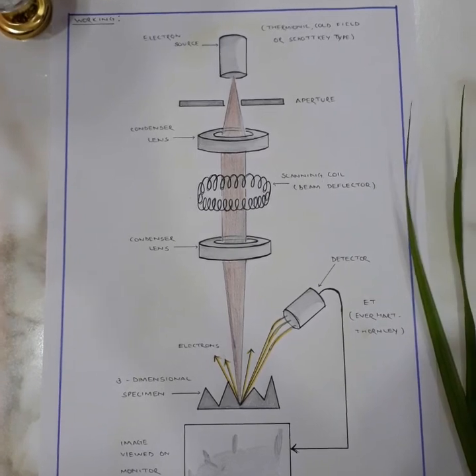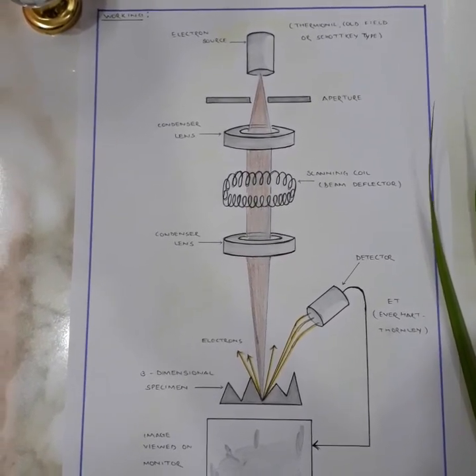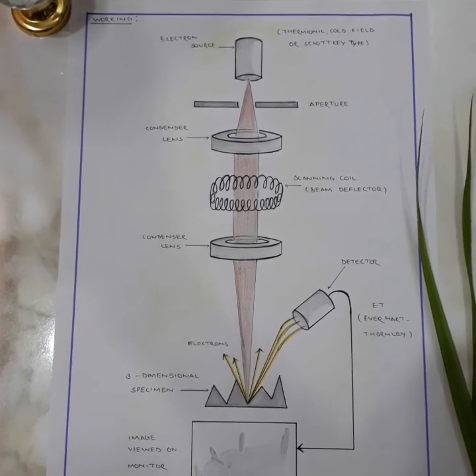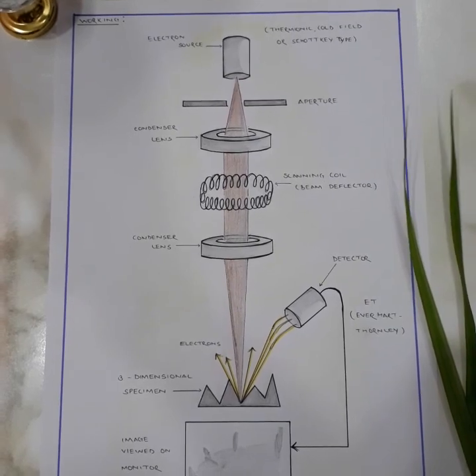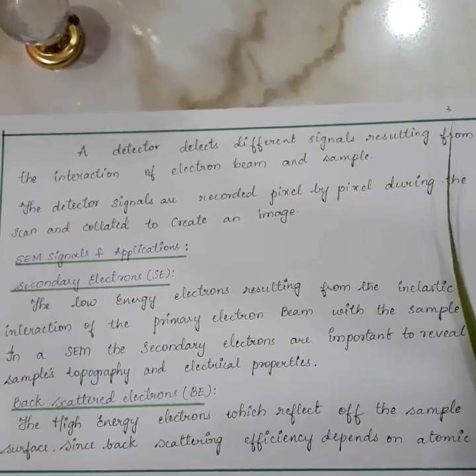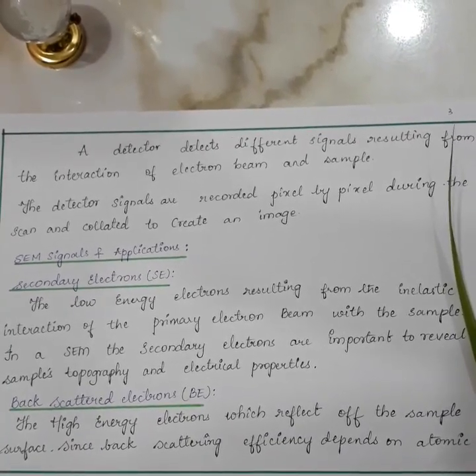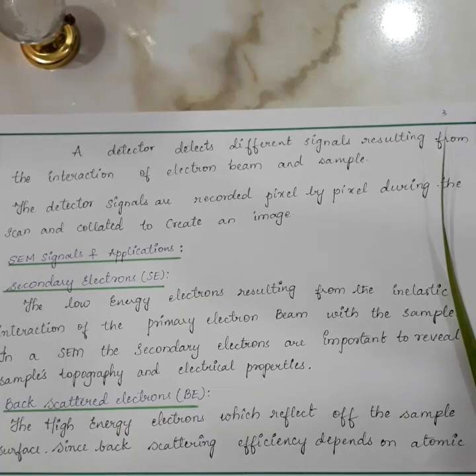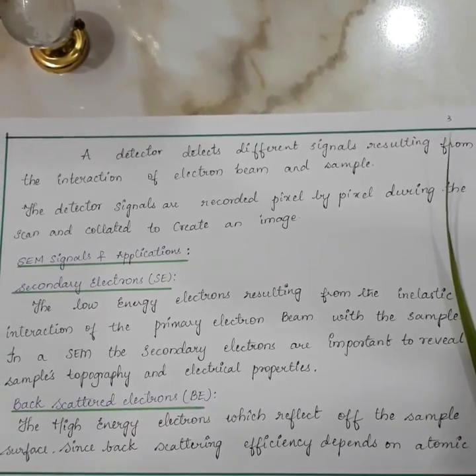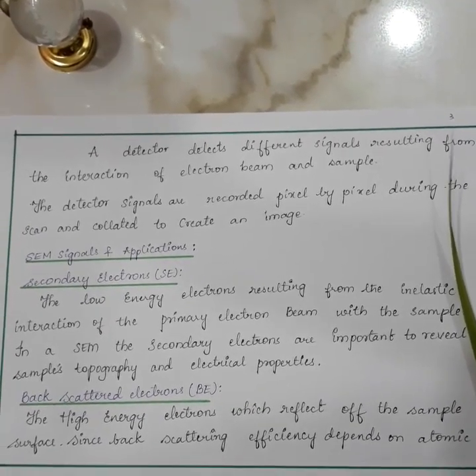The interaction of the electron beam and sample produces many different signals that provide a wealth of information and finds important applications. Secondary electrons are the low-energy electrons resulting from the inelastic interaction of the primary electron beam with the sample. In a SEM, secondary electrons are important to reveal the sample's topography and electrical properties.